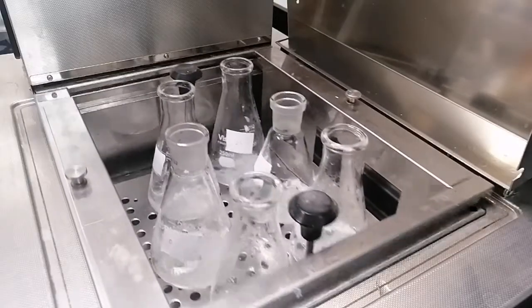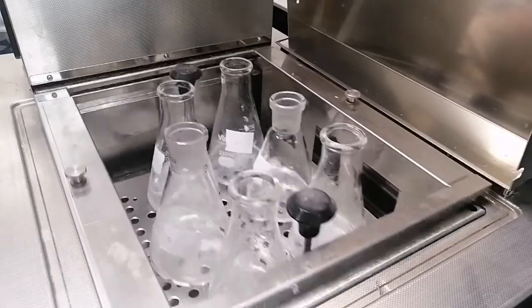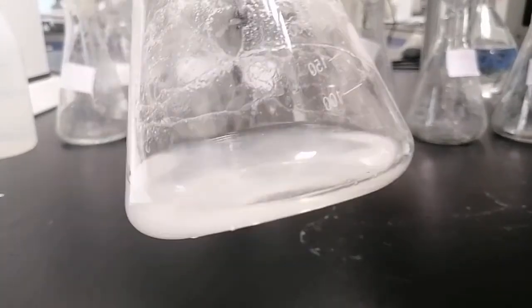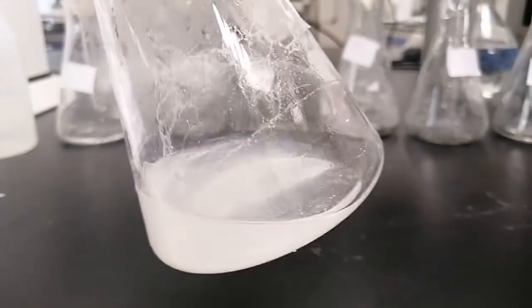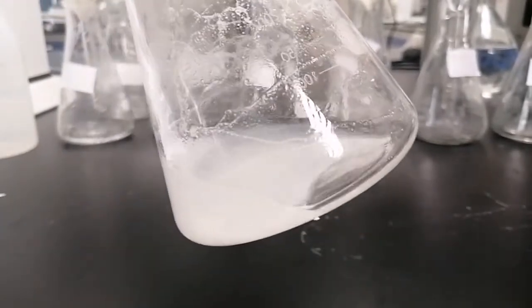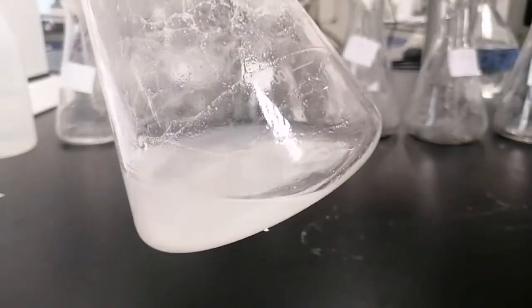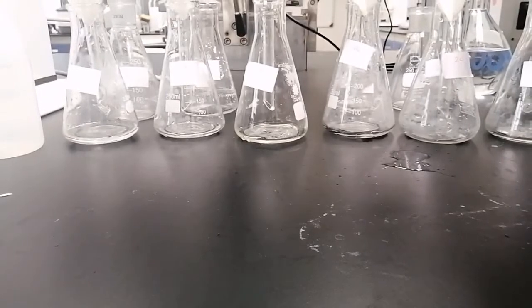Okay, and now we have finished the shaking of these solutions. We will filter them using filter paper and the filtration setup you've seen before. And now, as you can see, the solution is not completely miscible. Lots of particles are not dissolved, and they are sticking on the wall. Now we need to filter them. This is an indication of how highly insoluble mefenamic acid is, and the dissolution rate is controlling its bioavailability. So we will filter it and measure the absorbance of this solution.